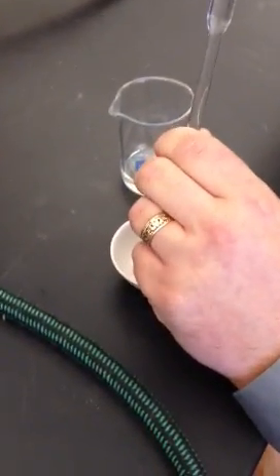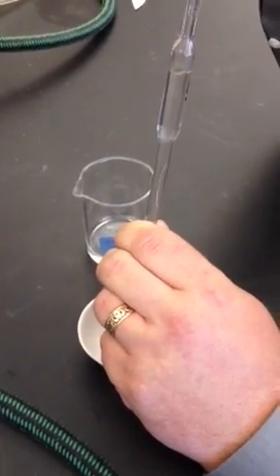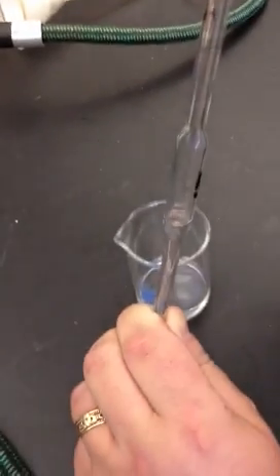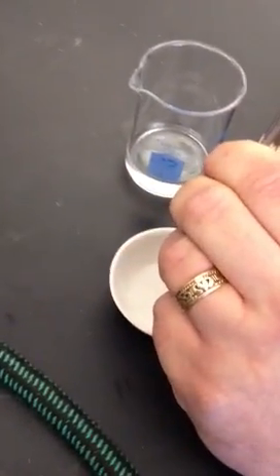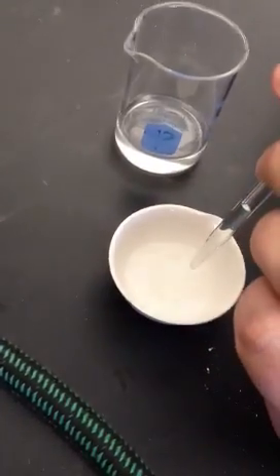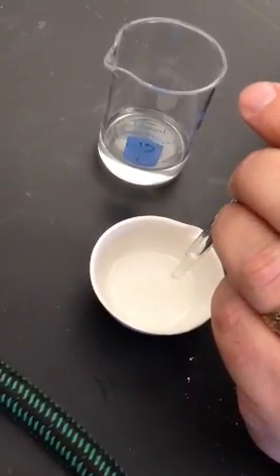I will then drain it into my evaporating dish here by hitting the E button. Now you'll notice as it drains, when you get close to the end, it will leave a little bit of liquid inside the tip of the pipette.